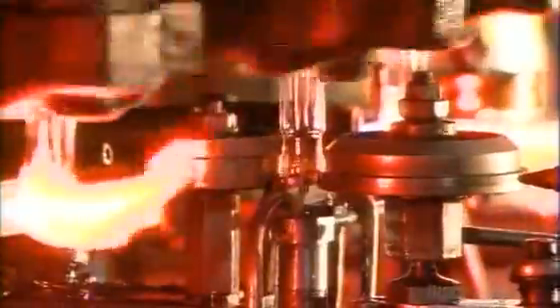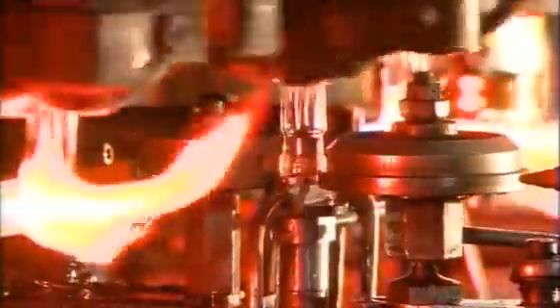A forming die squeezes the heated glass to sculpt the shoulder, while a steel plug rises from the bottom to open the vial even wider. Then a second forming die shapes the neck. Next, a parting burner splits the vial into 2.